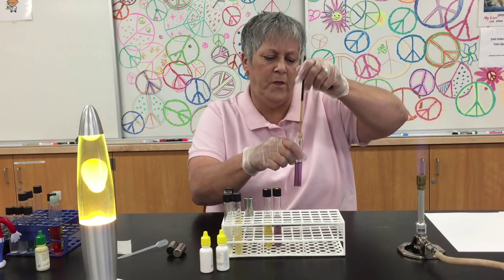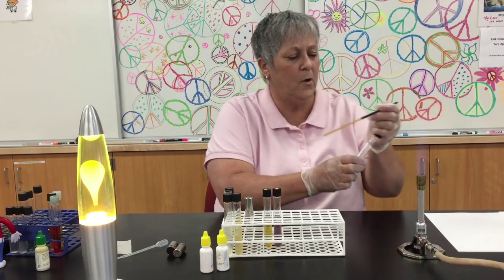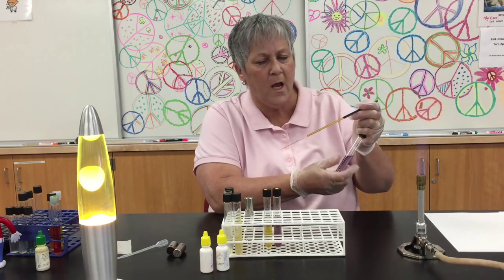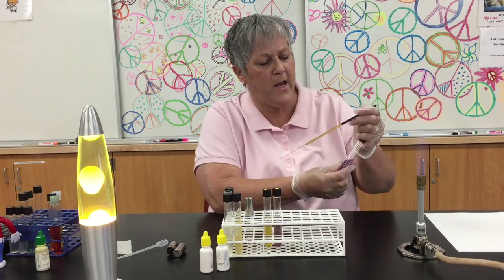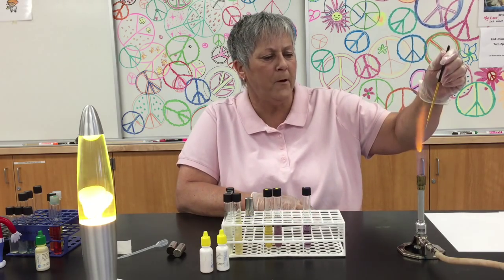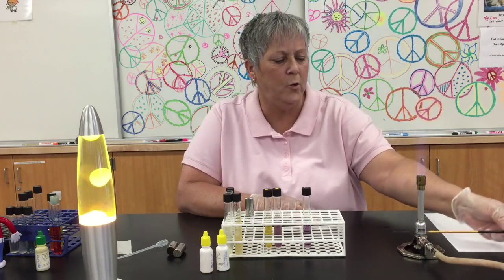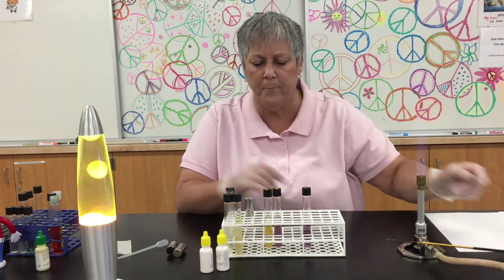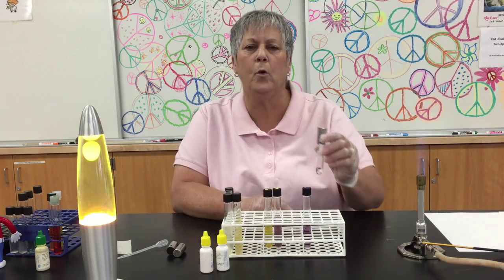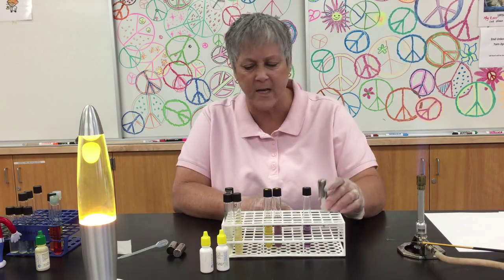This is a reaction that occurs under anaerobic conditions. So after I make all of my inoculations, I'm going to add a layer of sterile mineral oil to each tube. You need about a quarter inch to a half inch layer. You can either pour the oil into the tube, or you can use a sterile pipette to add it.